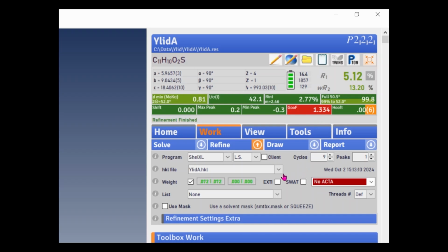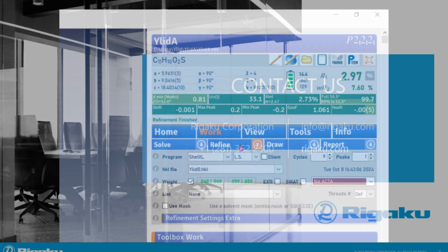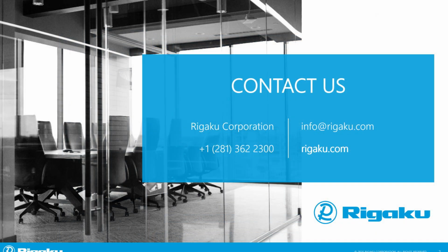I've copied the new HKL file into this structure folder, and I can select it here with the HKL dropdown. Now I refine the structure with the updated HKL file for a few cycles of refinement. The R value settles down to just below 3%, and the goodness of fit moves right into the range where it should be for an excellent data set and structure.